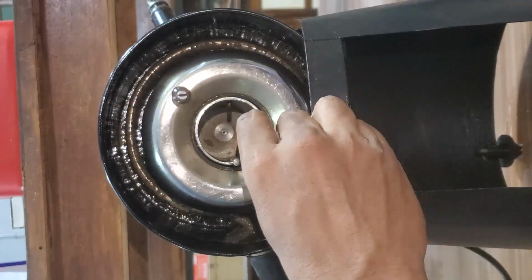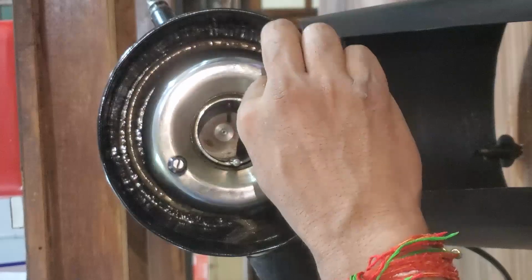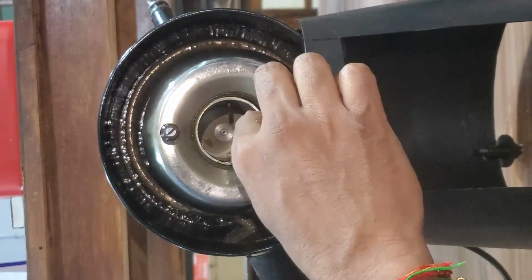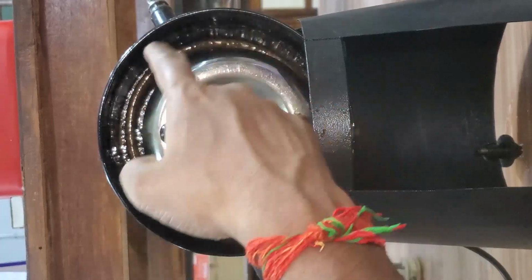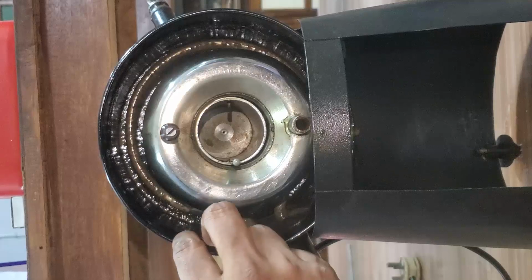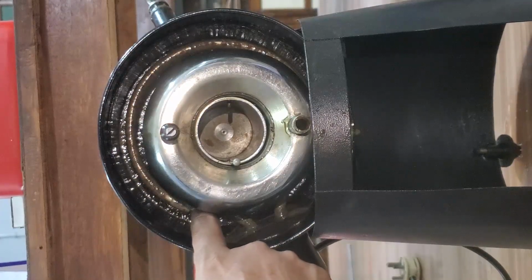This is actually the stirrer. And here the coil is there. We'll pour water here. So in this view we can see all these things. One is the heater coil, because we want to check the viscosity of the oil at different temperatures.